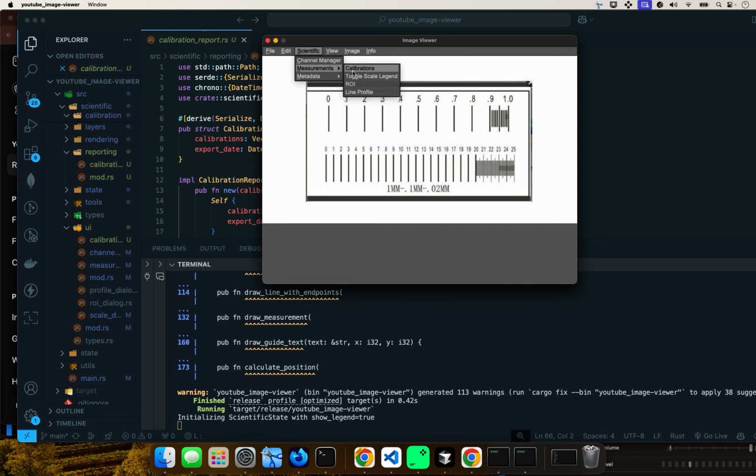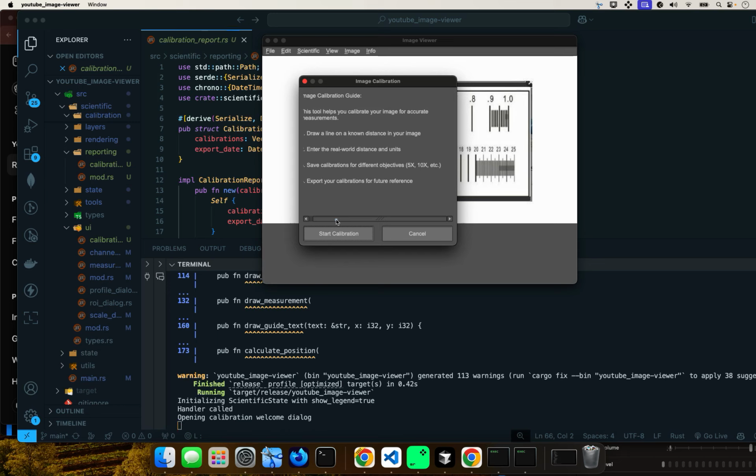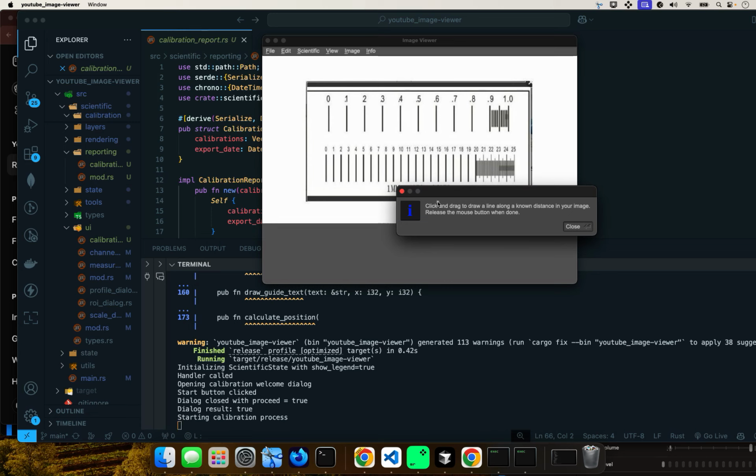But now it has this new calibrations tab, and it has a guide that actually tells you what to do. It gives you the instructions to follow. It tells you this tool helps you to calibrate your image for accurate measurements, tells you to draw a line, enter the distance and the objective, and then export. So you start calibration. It tells you to click and drag to draw a line along a distance in your image.